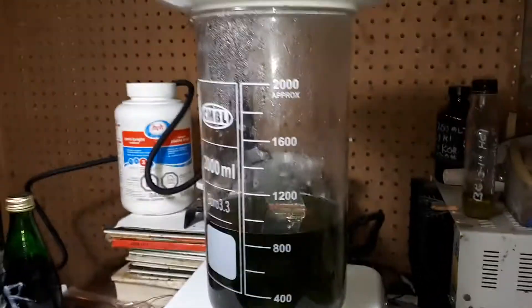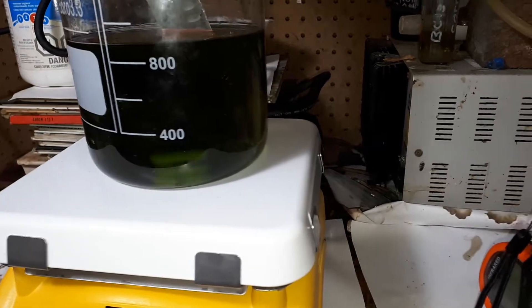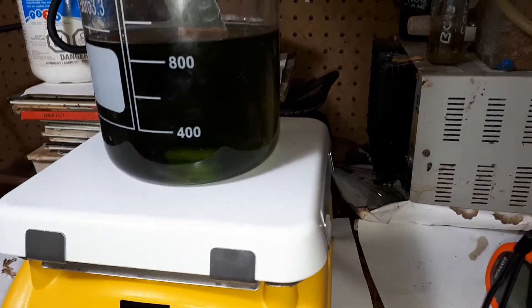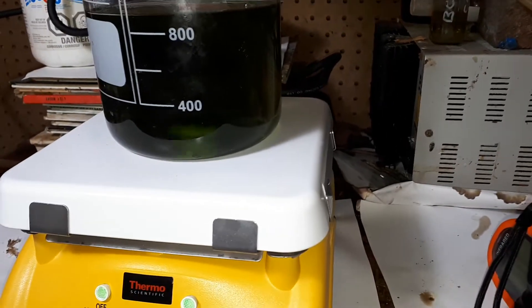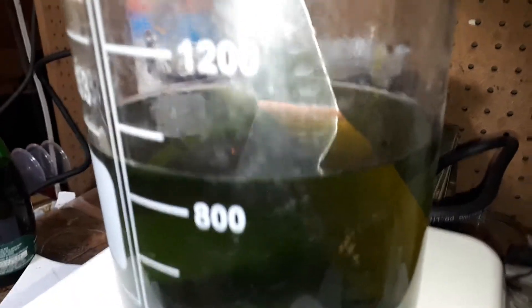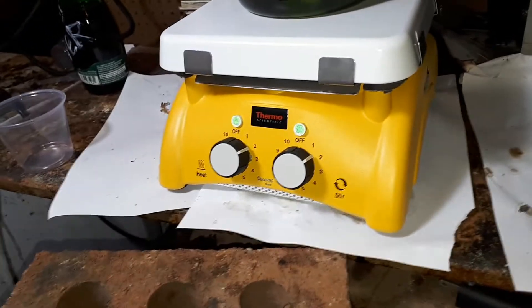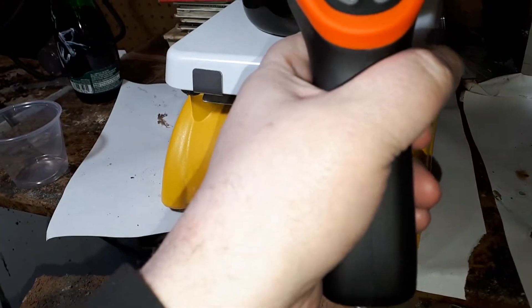I have a new hot plate and I have copper chloride, one mole, prepared from 7% hydrochloric acid with about 200 millilitres of 3% hydrogen peroxide. As you can see very carefully, that's a stainless steel knife being plated with copper. I'm heating it and the heat sensor reads 50 degrees.